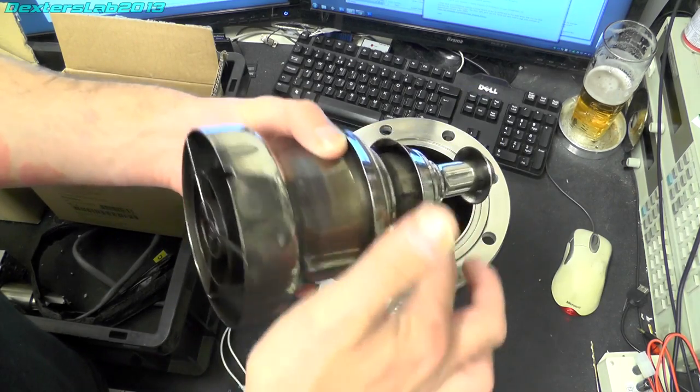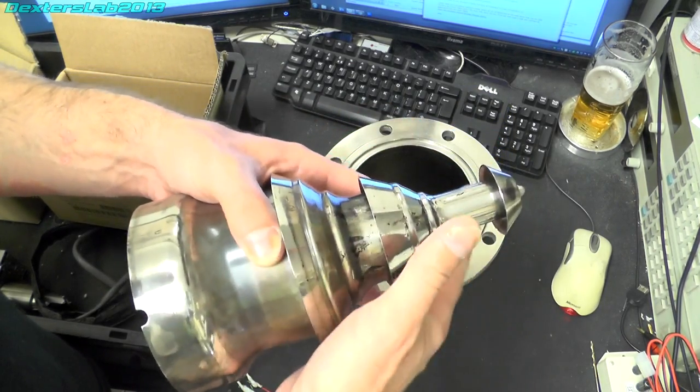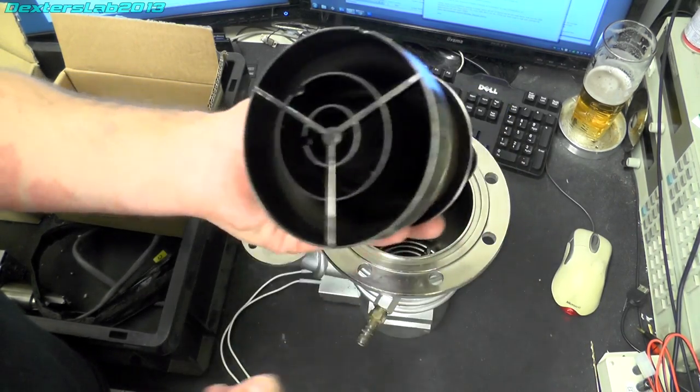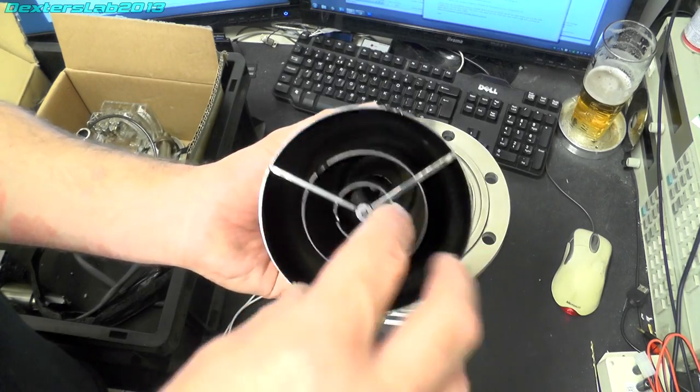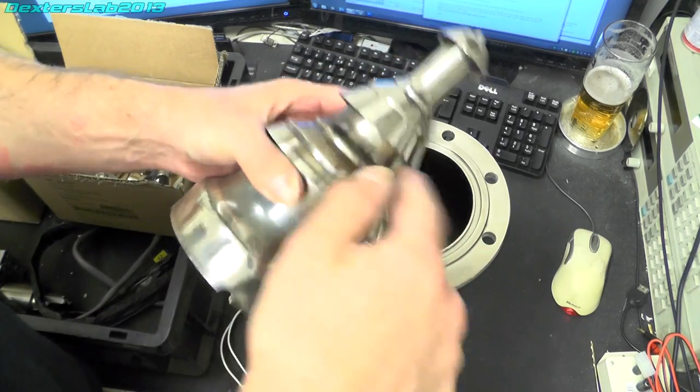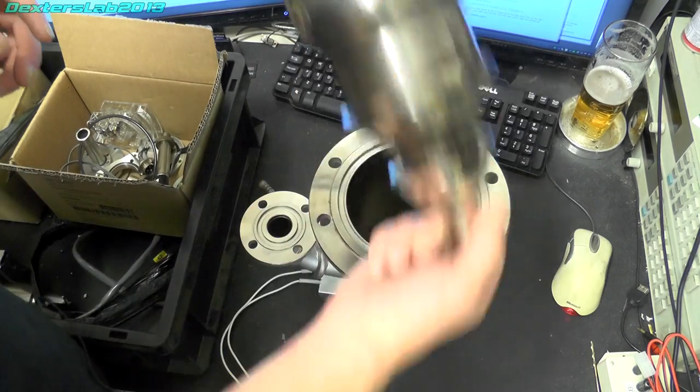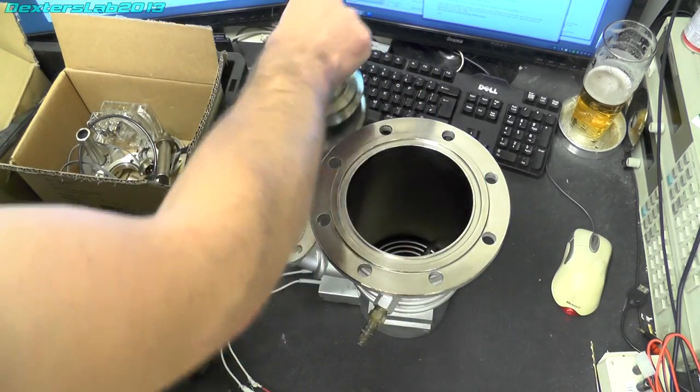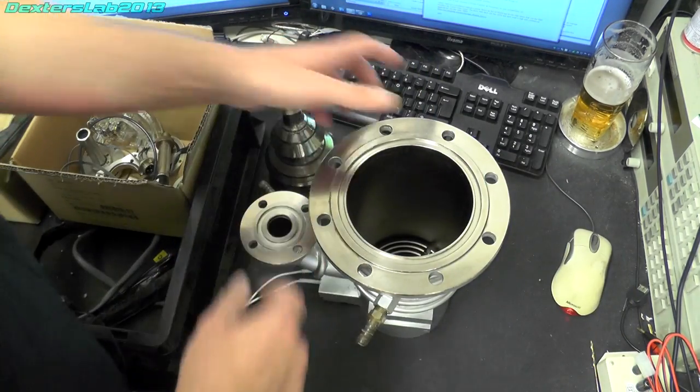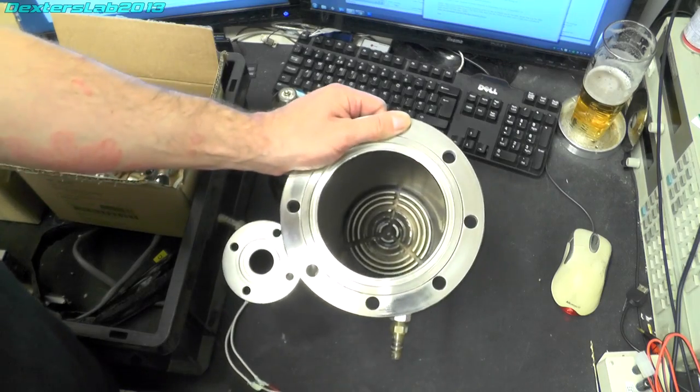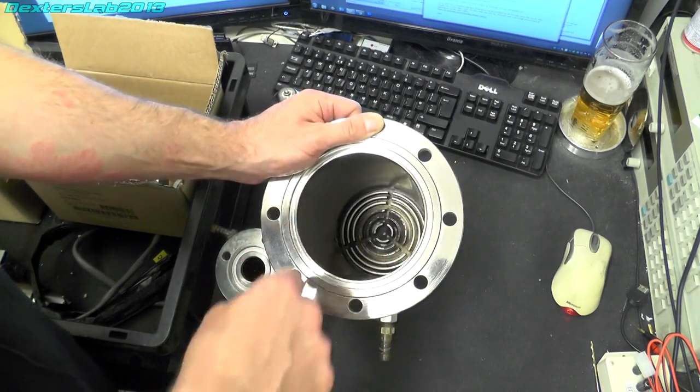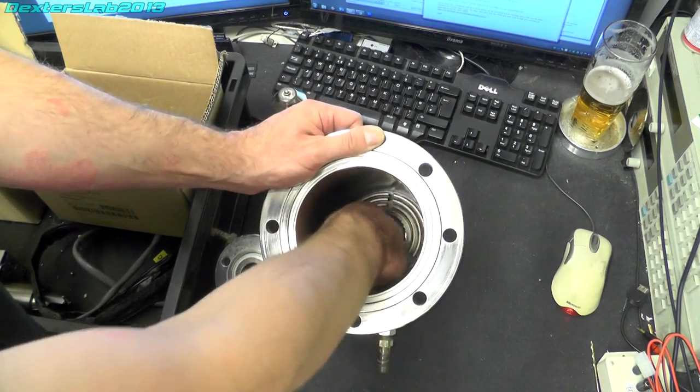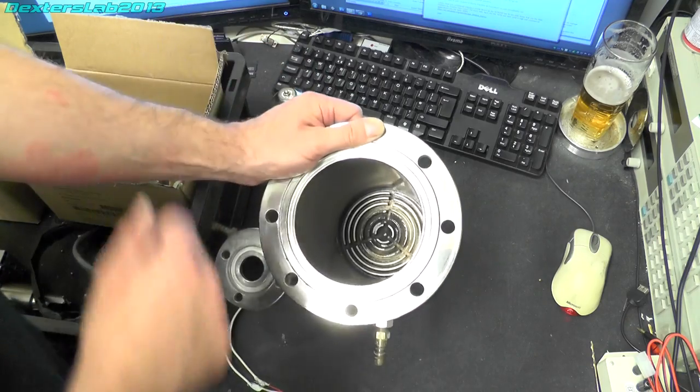You've got an outlet there and an outlet just in there. And then these two chambers which run up to those. And that's basically all that is, it's just a few bits of metal. And then in the base we have a number of metal rings that this just locates into.